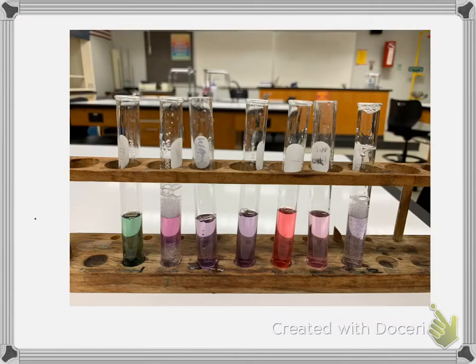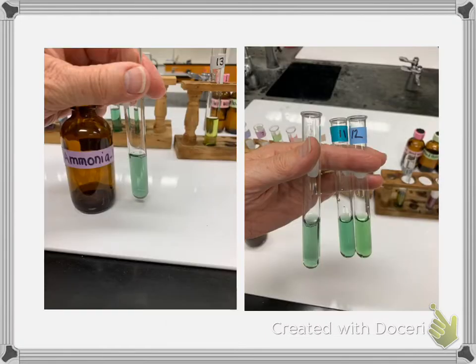And so here are what my solutions look like. I did mix them, but the two that are foamy, the hand wash and the Tide, I tried to mix it, but the more I mixed it, the foamier it got. So when we try to match the colors, we'll look at the top layer of where the color is sitting. And so for part B, what you're trying to do is determine the pH of the household substance by comparing it to the scale we created in part A.